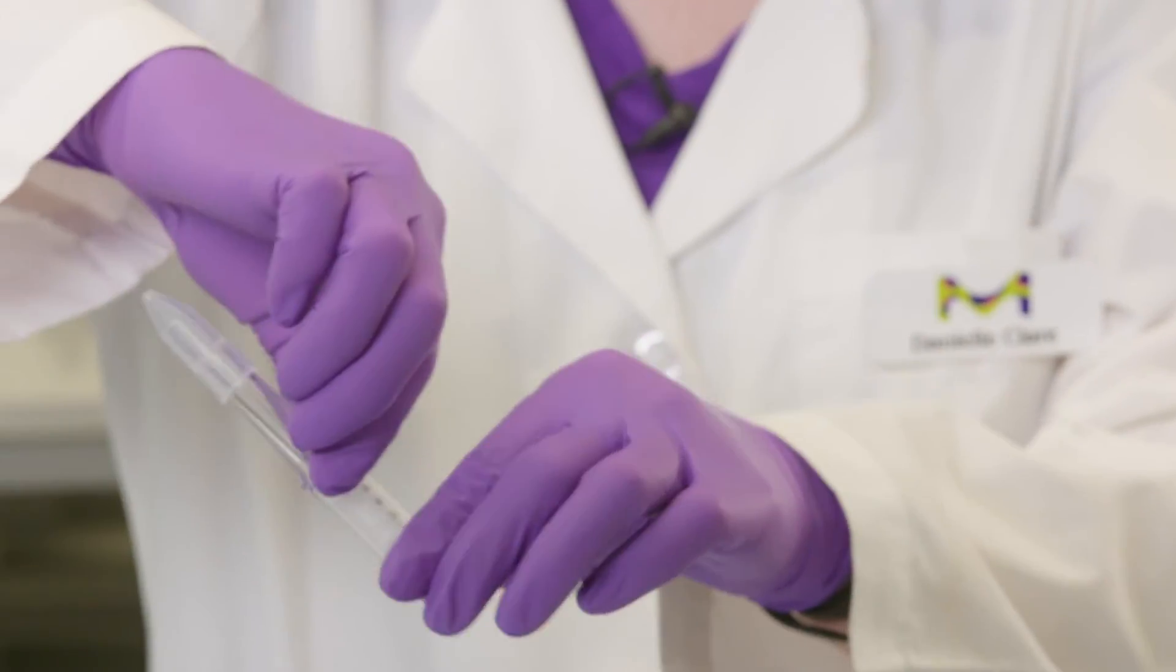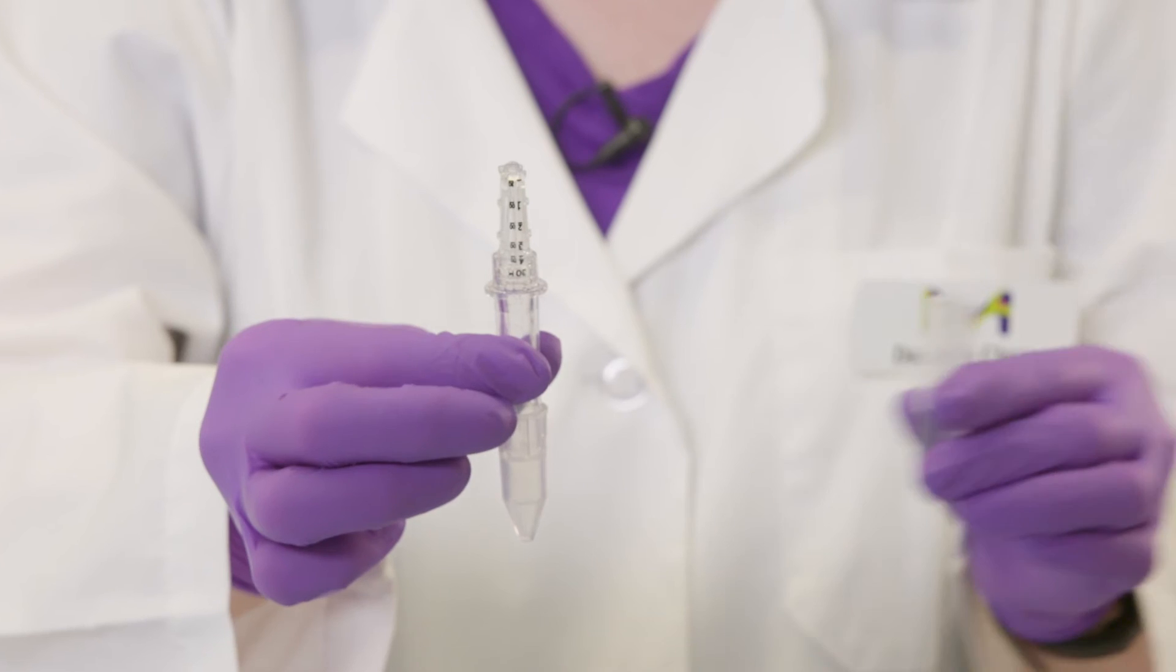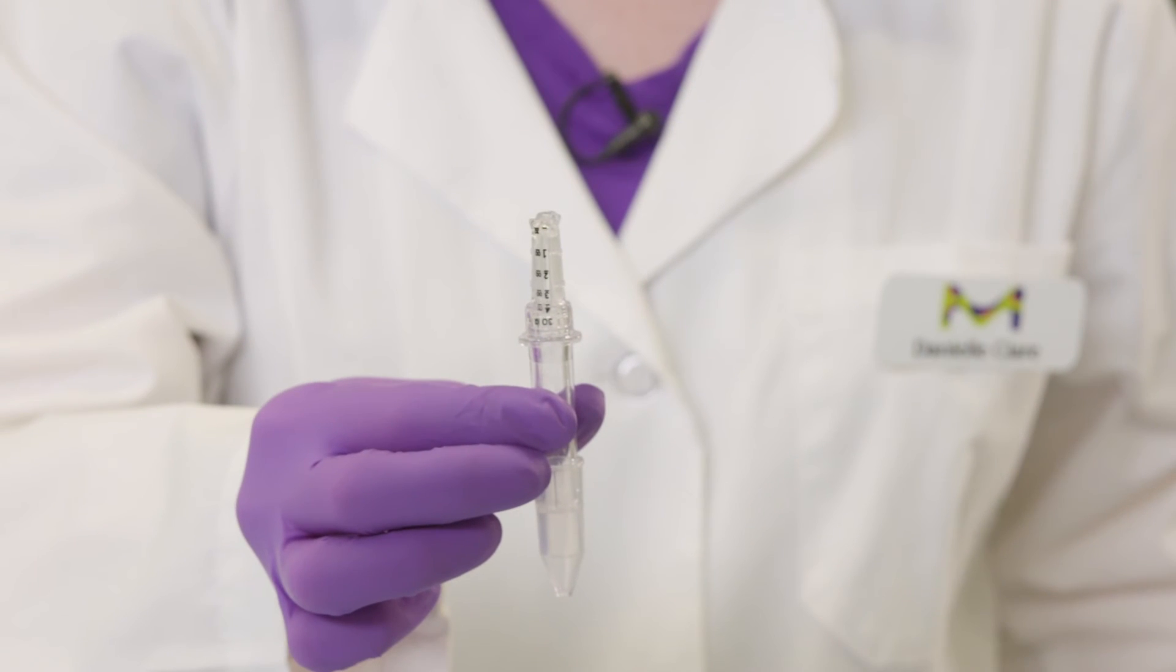The Amicon 2 milliliter devices have a special cone-shaped tube included in the kit which can also double as a cap for the initial spin.